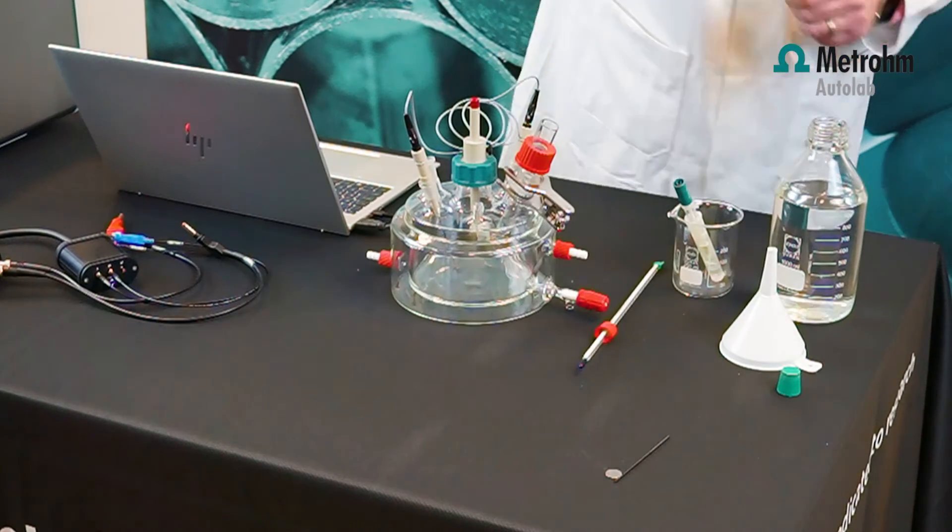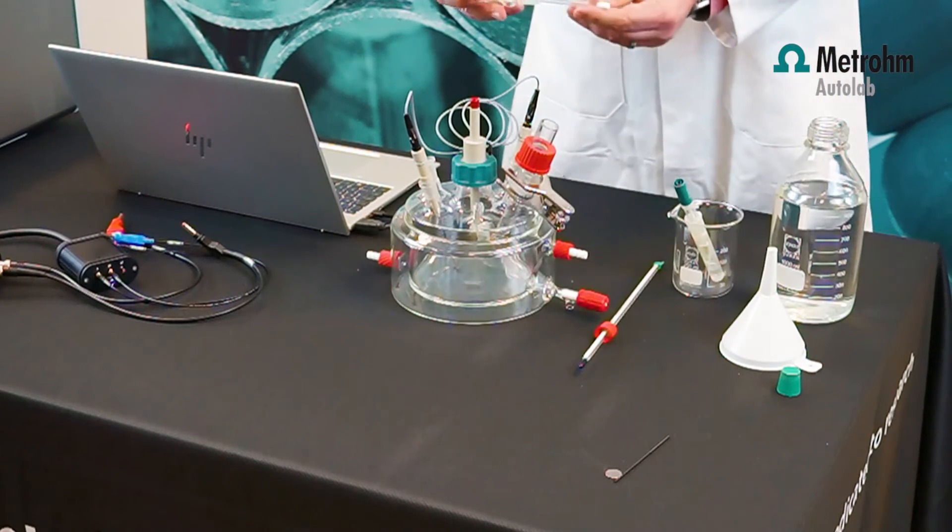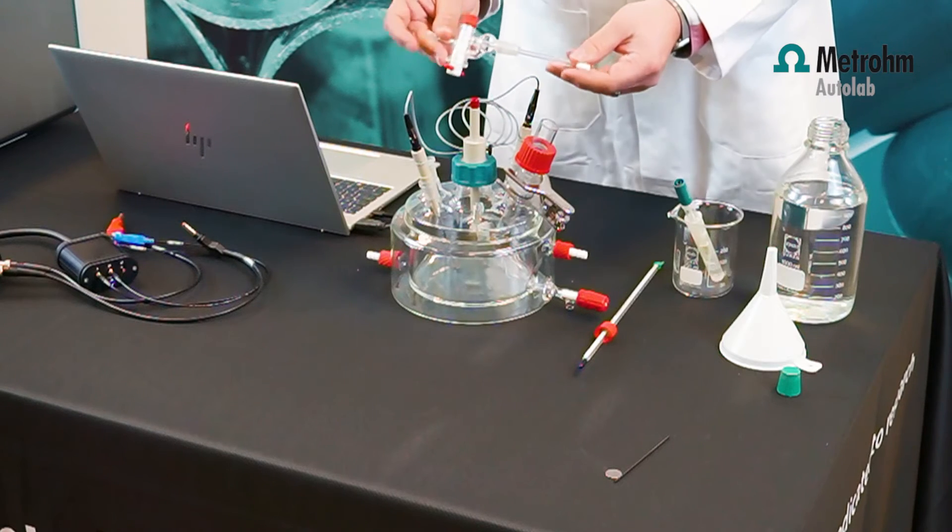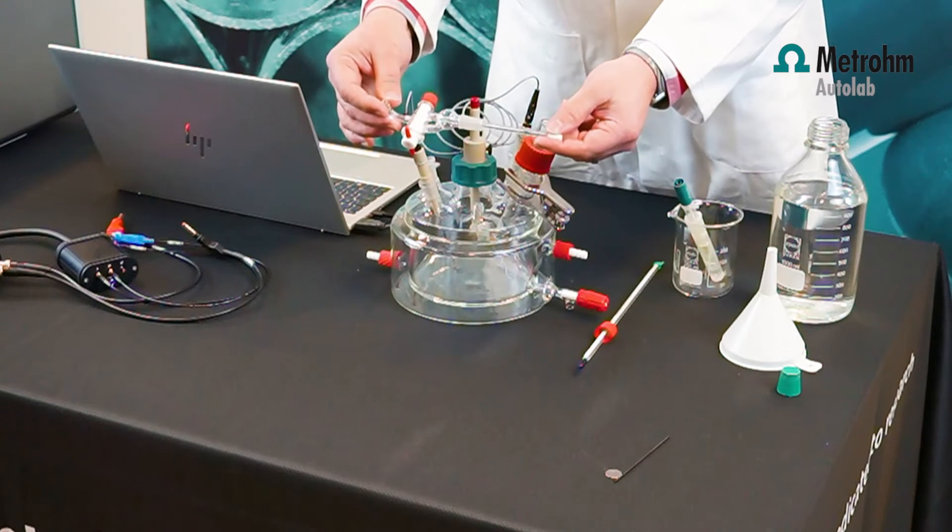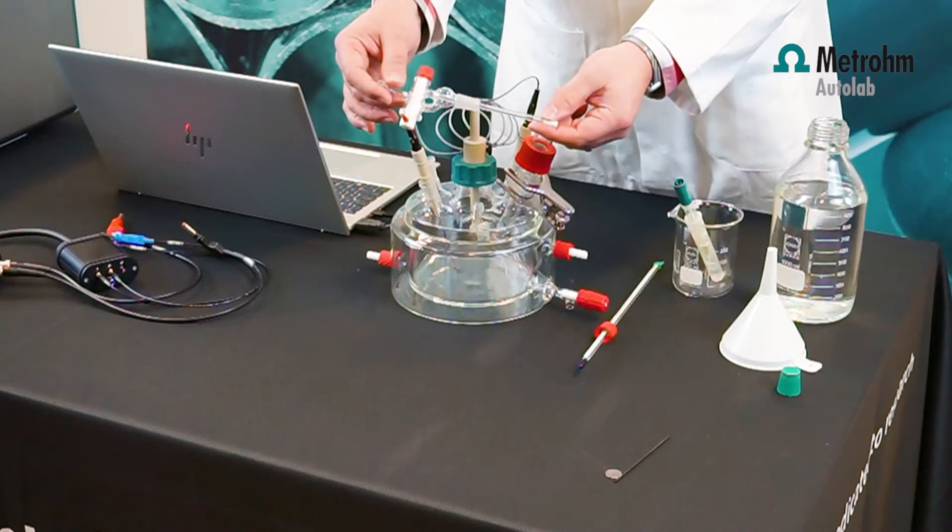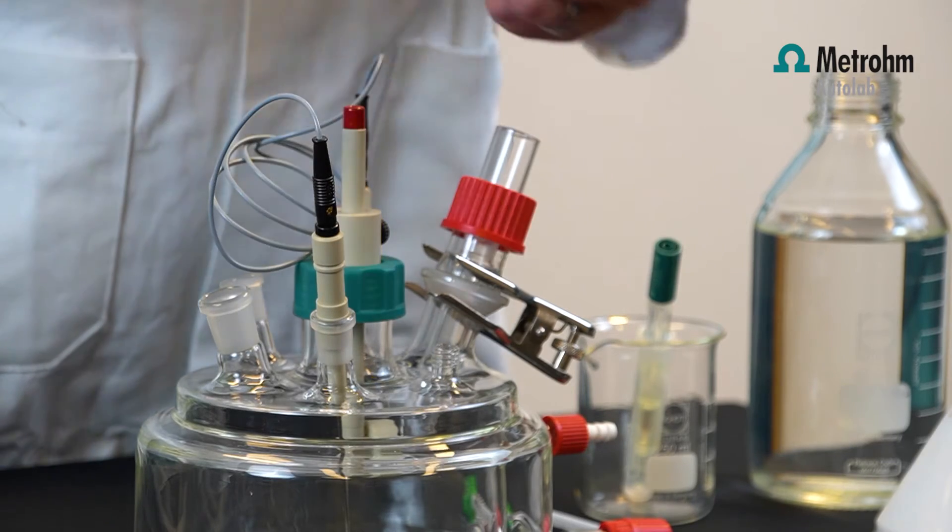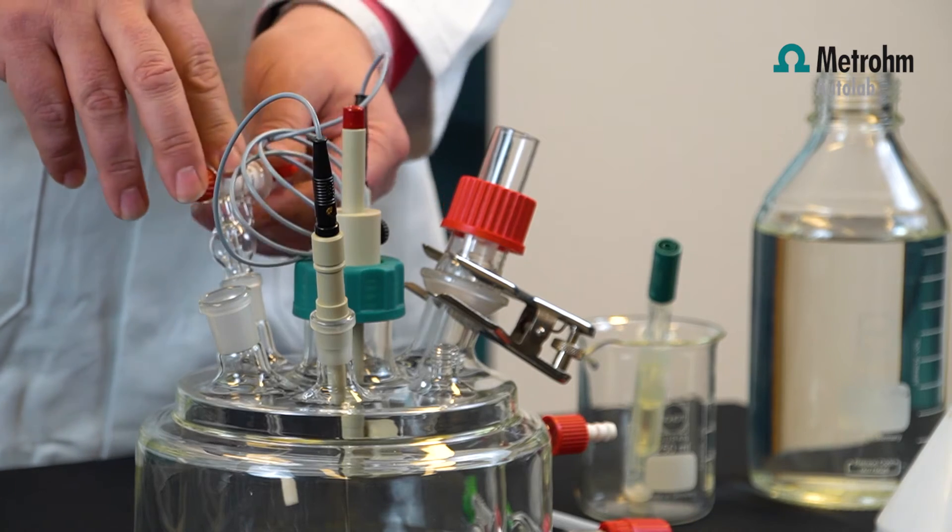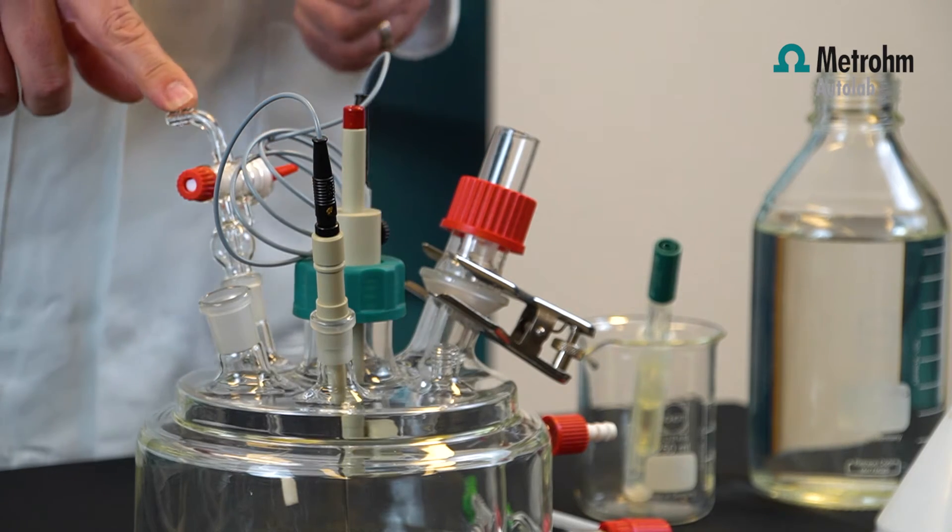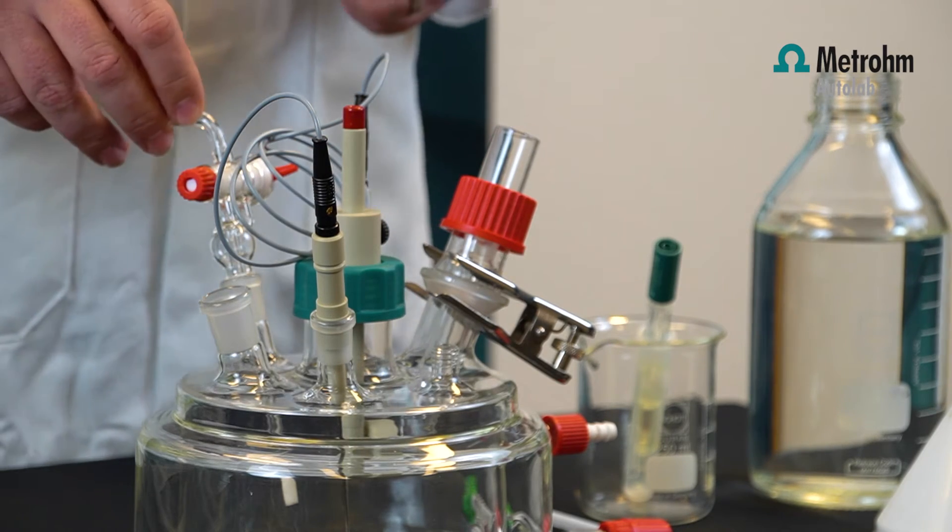Then we have a gas inlet. This gas inlet is there to put nitrogen for example through the solution, or you can cover the solution with a blanket of nitrogen if needed. You can attach a gas bottle to this gas inlet.